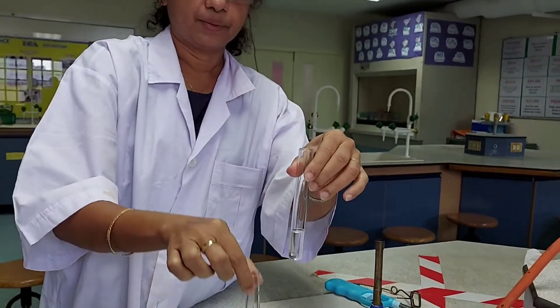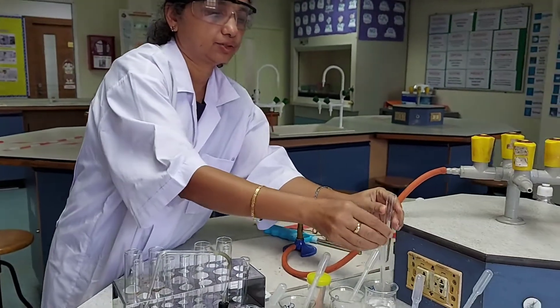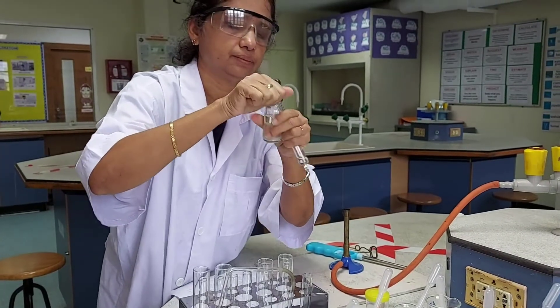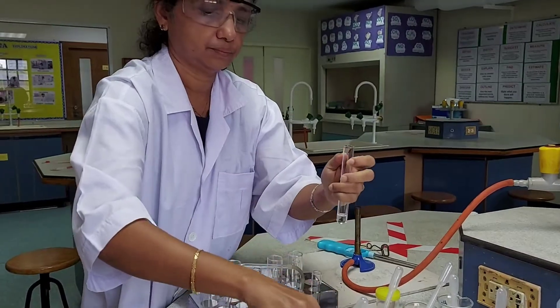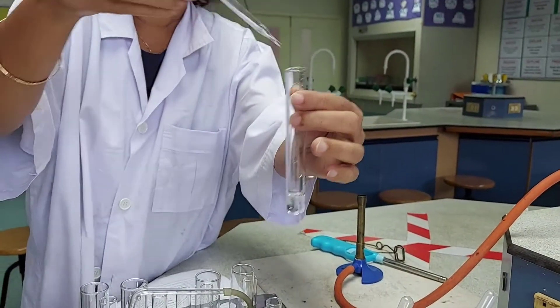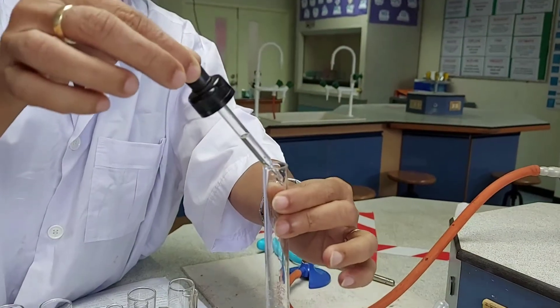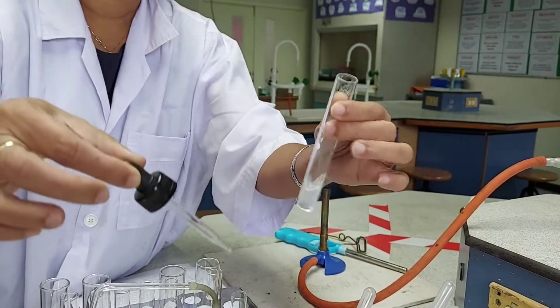I will repeat the same experiment for the solution with ammonium hydroxide. First, I will take a few drops of the given solution and add aqueous ammonia drop by drop. You can see a precipitate is being formed — a white gelatinous precipitate. Then I will add excess of ammonia to the solution to see if the precipitate dissolves in excess.